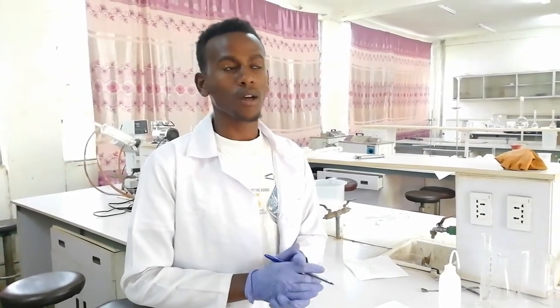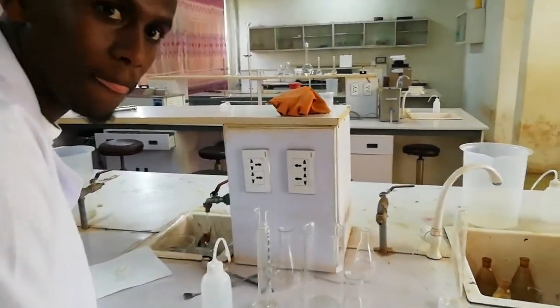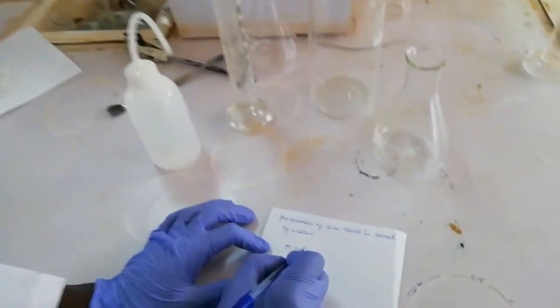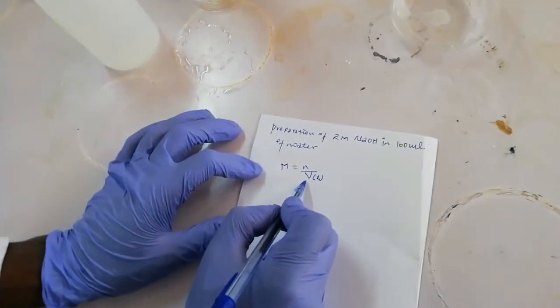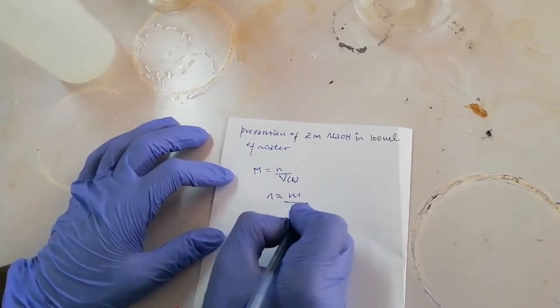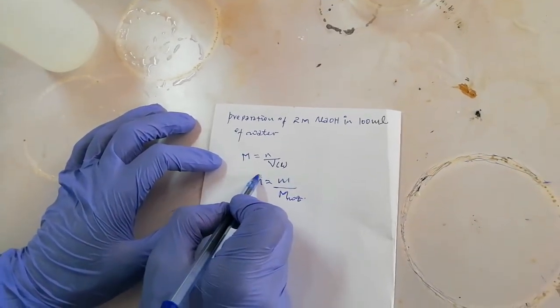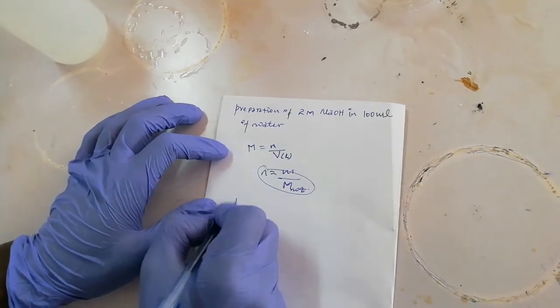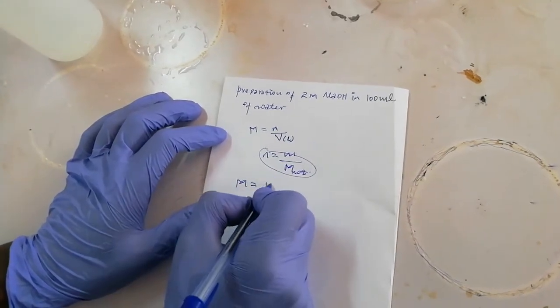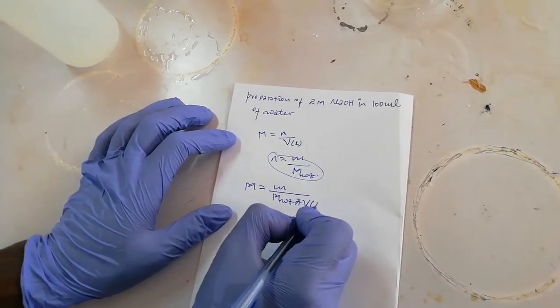To calculate the mass of sodium hydroxide, we use the molarity formula, which is: Molarity = number of moles of solute over volume in liters of solution. The number of moles of solute equals mass of solute over molecular weight of solute. Substituting this into the molarity formula gives: Molarity = given mass over (molecular weight × volume in liters).